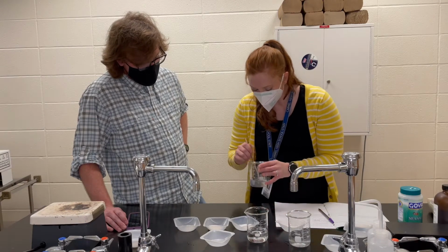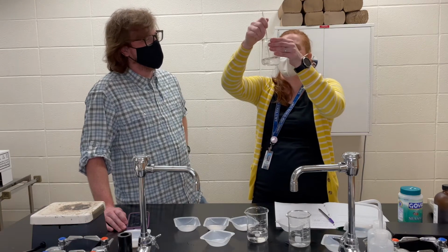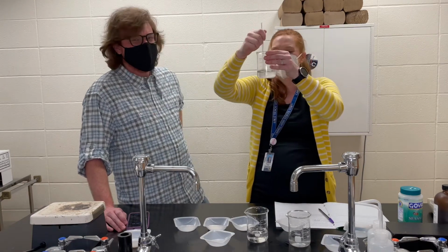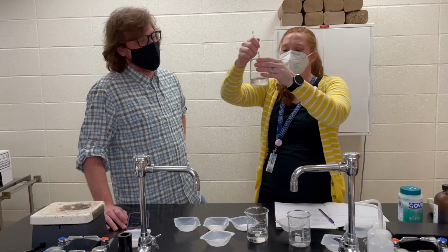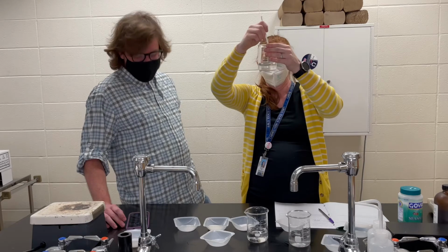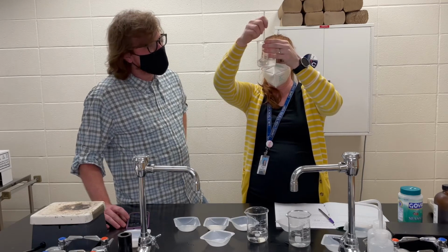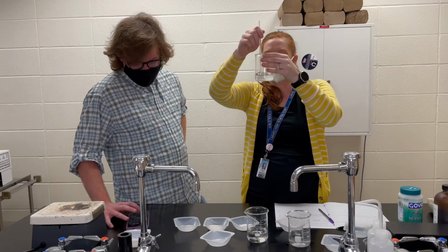Or Big C? It started out as Big C. We are getting a little bit of a Benjamin Button situation. Are you sure you don't want to time lapse this? No, I think the live video with the bell is actually ideal. Oh wait, where'd little C go? Big C. And much like Houdini, little C is gone.